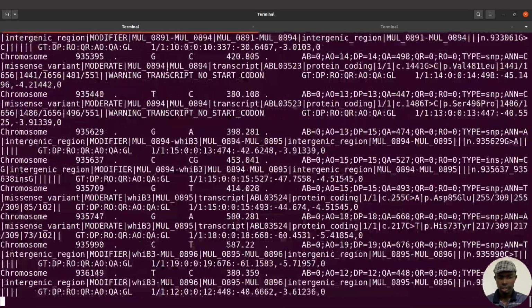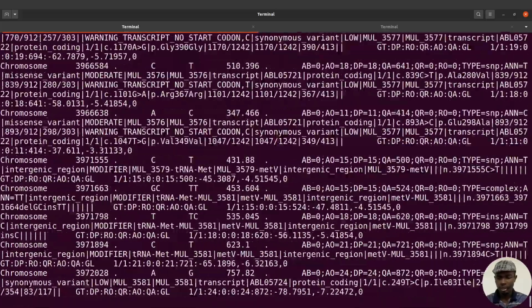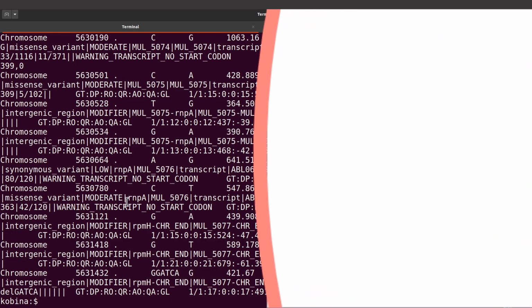Okay, perfect. So now it's been done. Now you can see that snpeff is working nicely. So far, you have not seen any error. Everything is being done. You can see that the variant effects have been predicted for us. You can see all of them here.